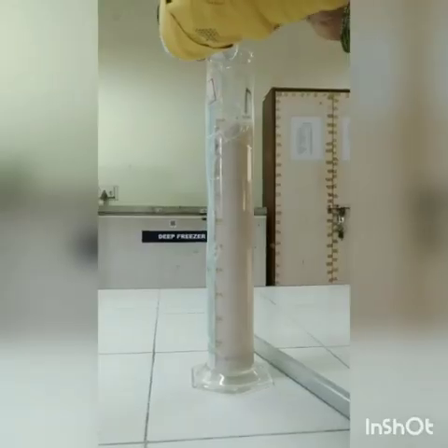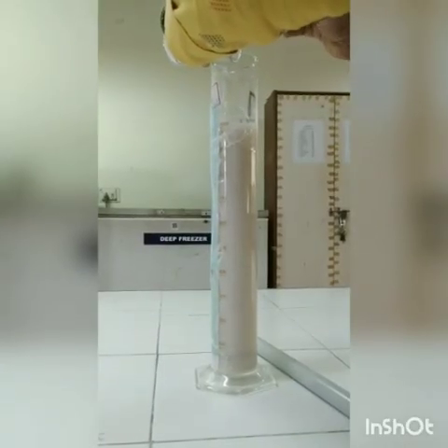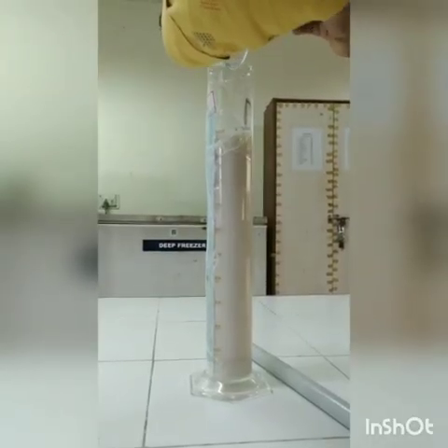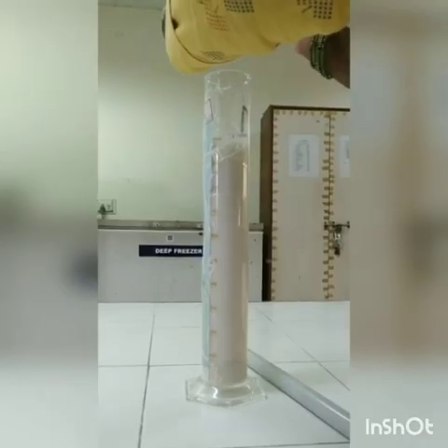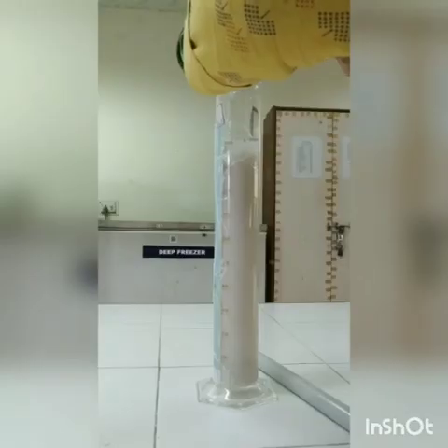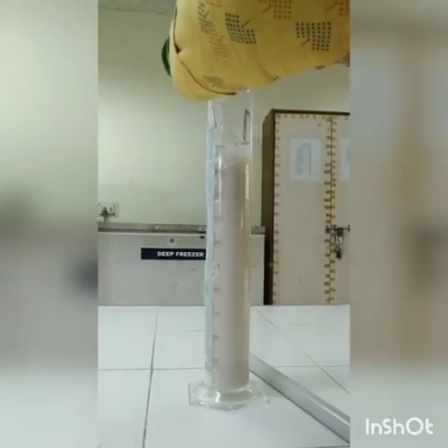You can see at the bottom the lime is going and settling, which indicates that it has high particle density in the mixture, so the heavier particles go and settle at the bottom, and the lighter particles float, and the dusty particles will be in the intermediate. So now we need to make a homogeneous mixture in order to determine the overall sedimentation velocity.